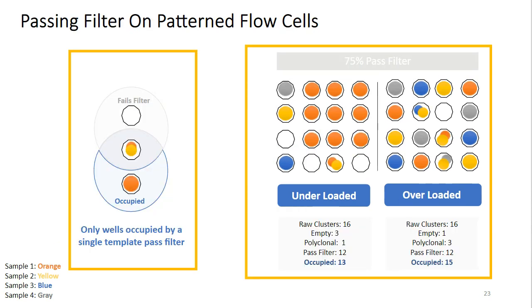Now, looking at the figure on the left, we can see that after clustering, nanowells will pretty much exist in one of three states: they'll be either empty, occupied with a single template, or occupied with multiple templates. Empty wells will be listed as unoccupied, but they will also not pass filter. Wells that have multiple templates will be listed as occupied, but they will also not pass filter. Finally, nanowells that have a single template will be occupied, and they will typically pass filter. So now that we have a basic idea of what determines if a cluster passes filter, let's take a look at two different scenarios where the clusters passing filter are both 75%.